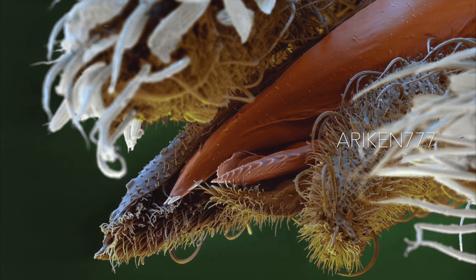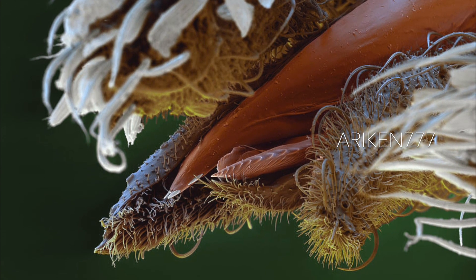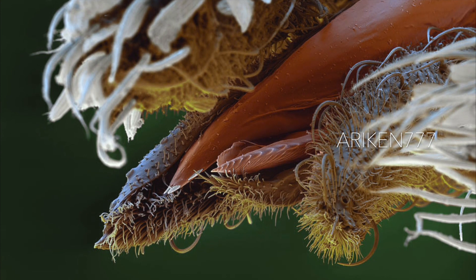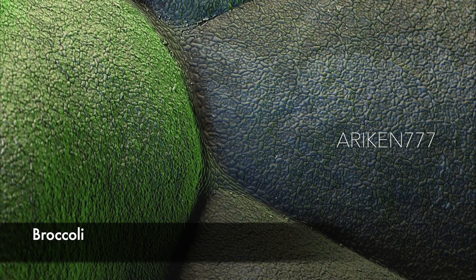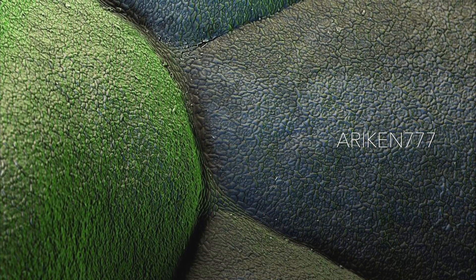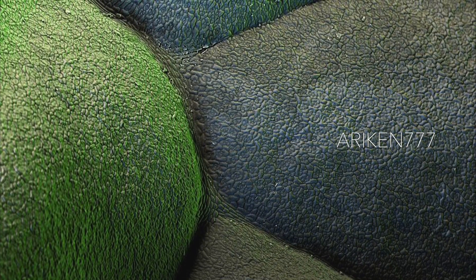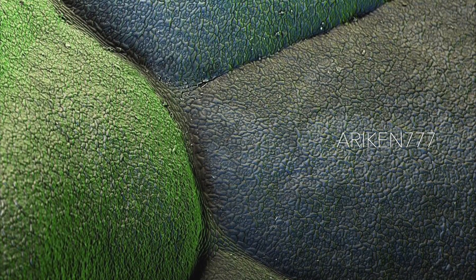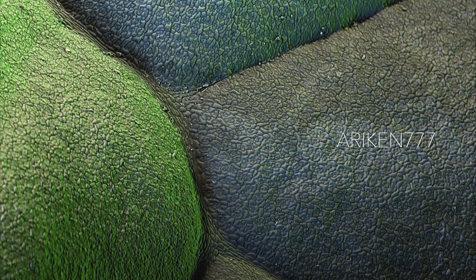Only female mosquitoes bite people and animals to drink blood and can transmit malaria. A close-up view of broccoli showing its epidermal cells — epidermal cells include several types of cells that make up the epidermis of plants. Although they serve a number of important functions, their primary role is to protect from a variety of harmful factors, including microbes, chemical compounds, and ultraviolet light, among others.